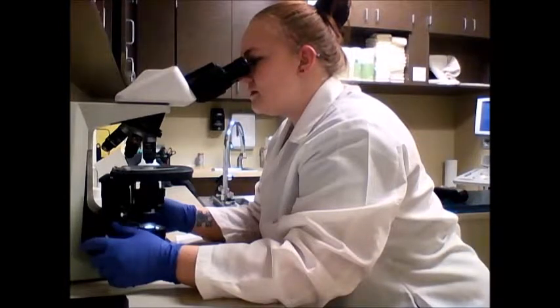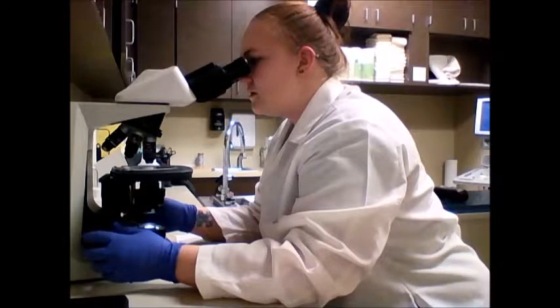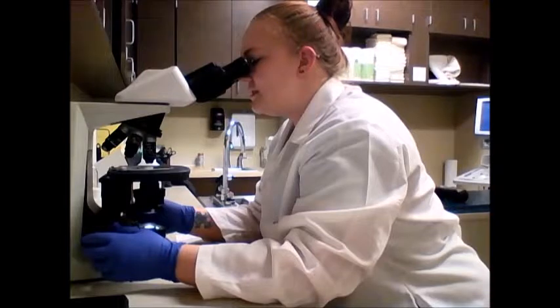Staining still looks even in the monolayer, very large area to work with and see and do our counts. I don't see any abnormalities or air bubbles or signs of streaking throughout the monolayer or the rest of the slide.